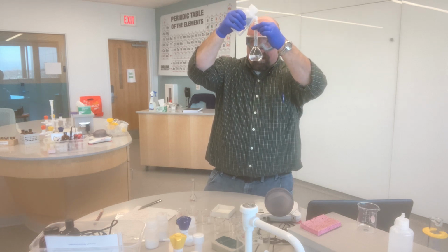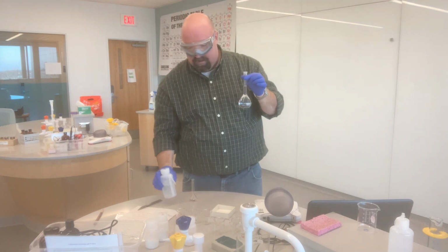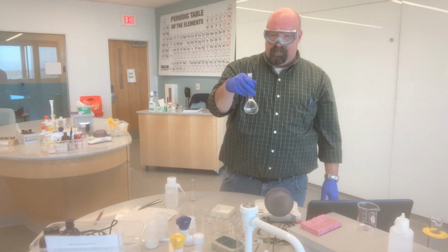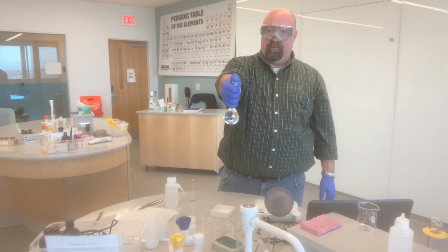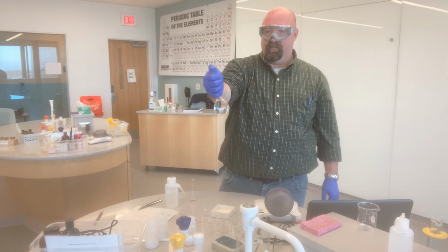You'll note that I'm looking at eye level as I bring this up to the line. Now the meniscus is right at my line. So here's my 100 milliliters. Now I'm just going to shake this a little bit. Nothing that we use is that dangerous, so in order to mix this up a little bit, I'm also just going to put my thumb over the hole here and invert this a few times.